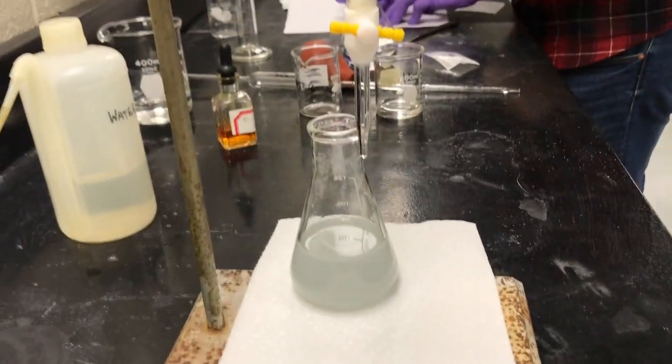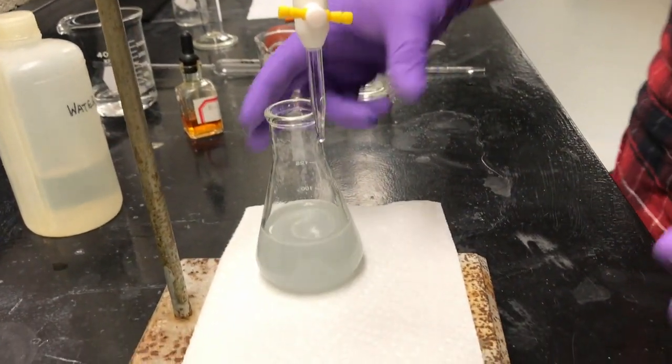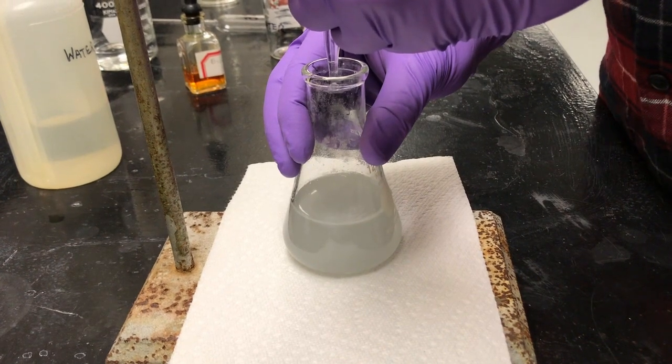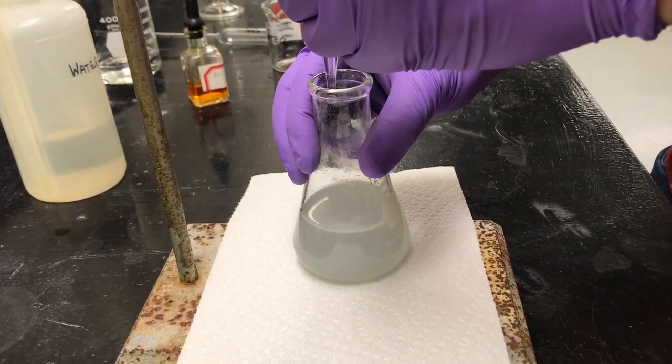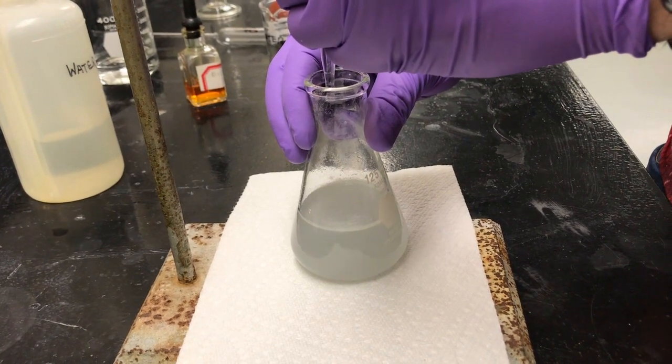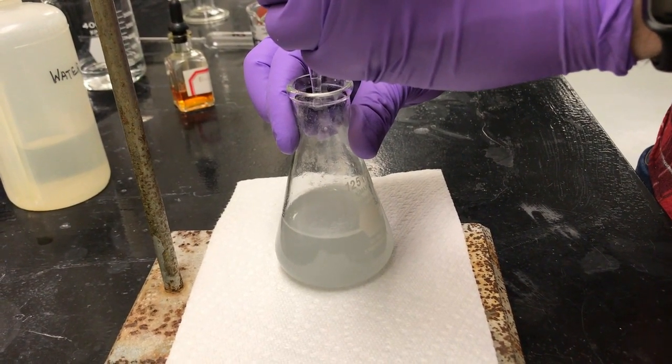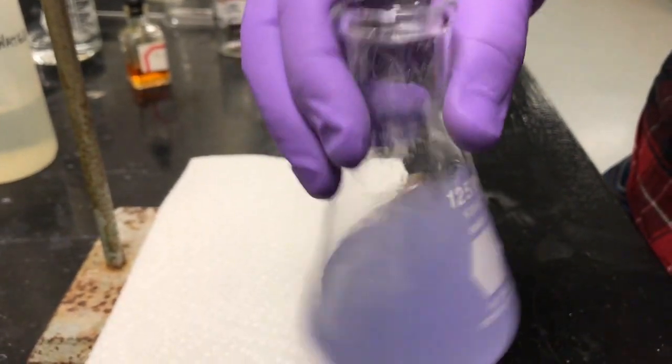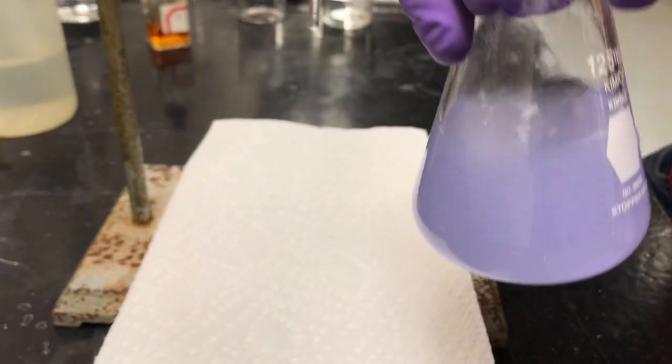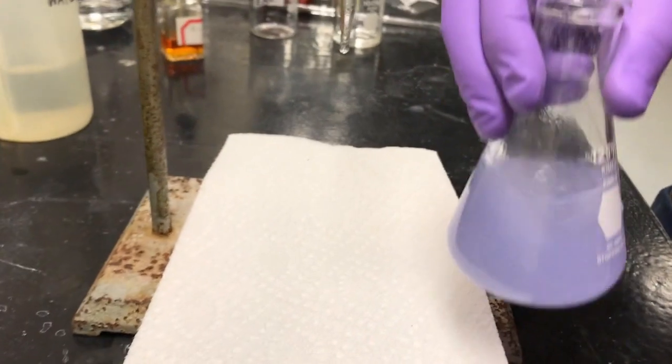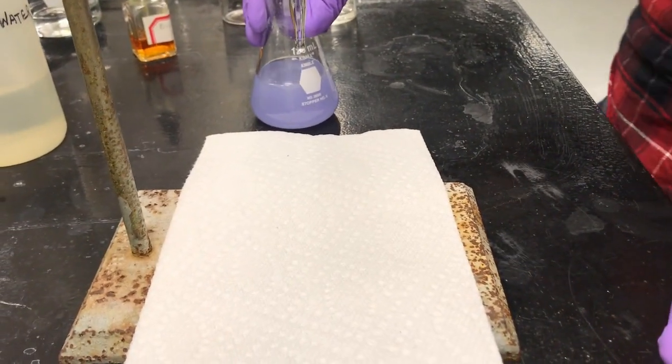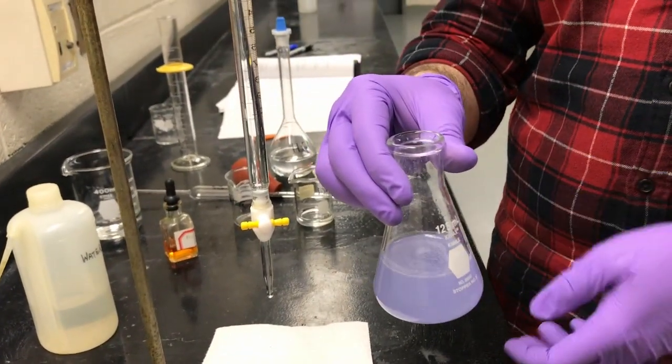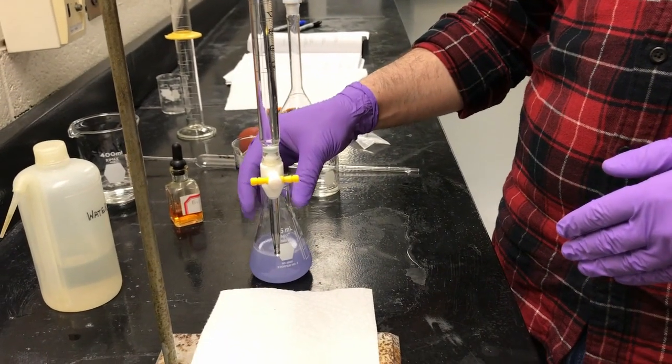Okay. So I'll start with it on a random piece of paper, just for right now. And then we'll add one drop. Just making sure I'm done. That didn't really do anything. It didn't swirl yet. Oh, shoot. That did a lot. Yep. Great. So we're done. Do you think, so this is the real endpoint? Yes. So what we just did was the real endpoint. Right. The hue changed, the color changed, so it didn't just get darker. It looked in between that initial yellow and this. So what we had just there was the endpoint. Great.